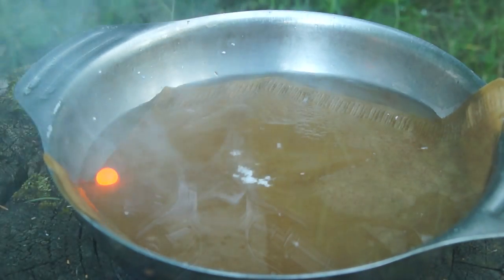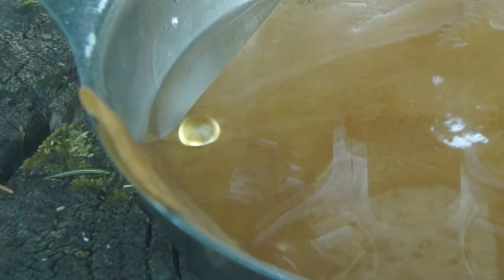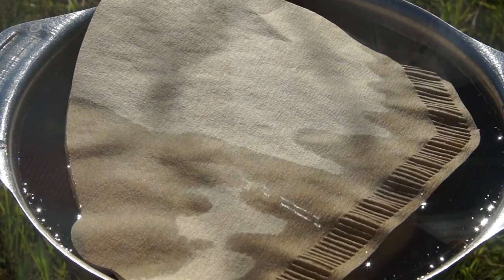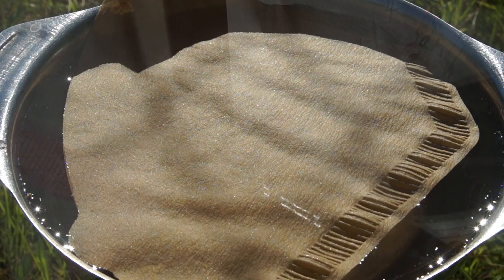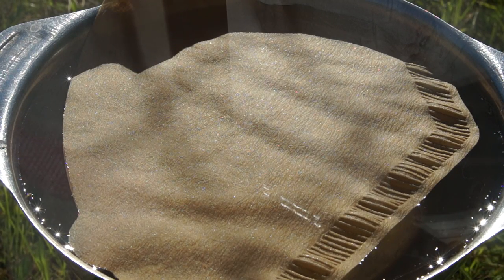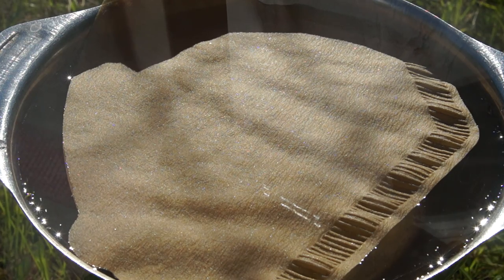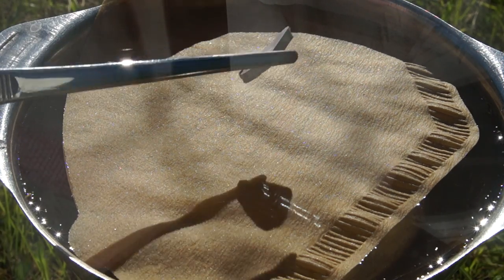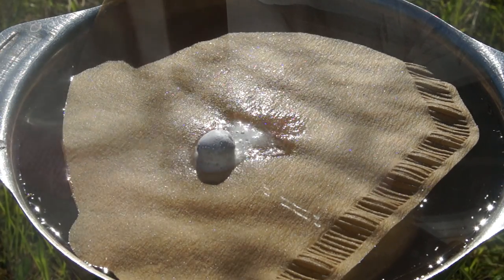However, if you perform the reaction of sodium with water under different conditions, we can observe a very unusual effect. Take a cup of water and put a filter paper on its surface. Take a medium-sized piece of sodium and put it on the wet surface of the filter. When sodium metal contacts with the wet filter surface, the reaction begins.